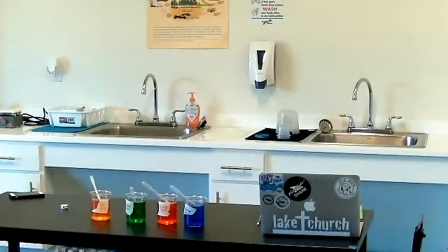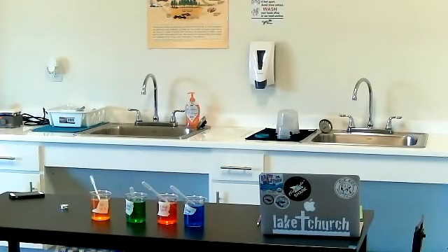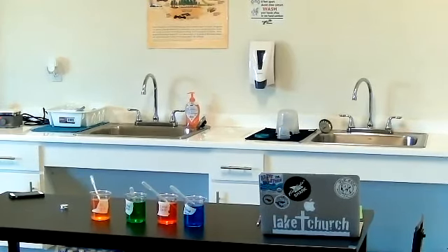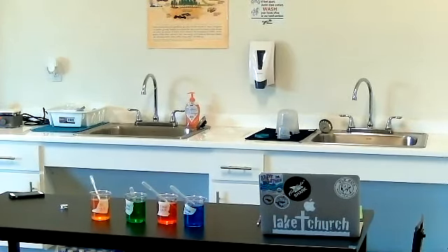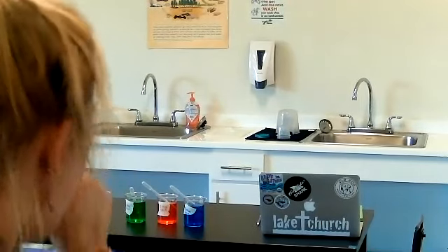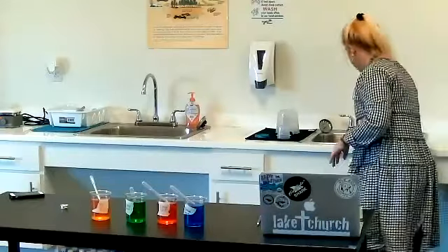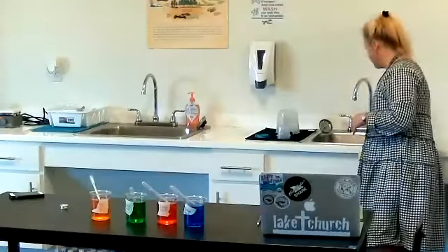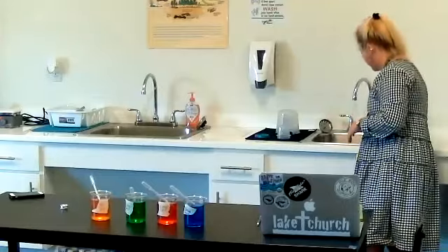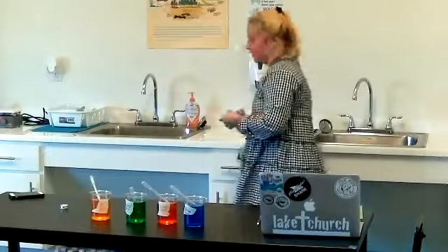It has something to do with salinity. This lab helps us figure out the relationship between salinity and density. We actually see that as the salt concentration increases, so does density. So density and salt have a positive or direct relationship with one another.